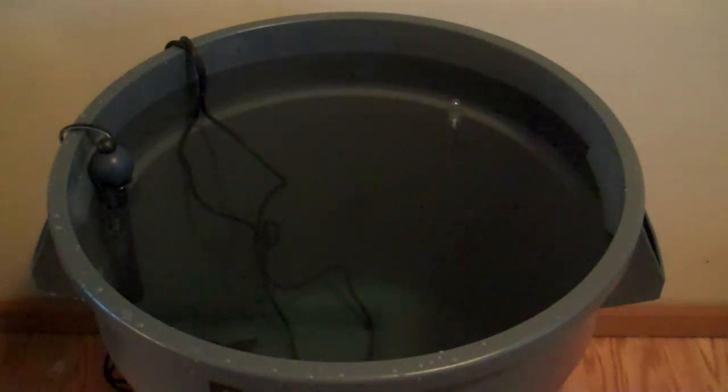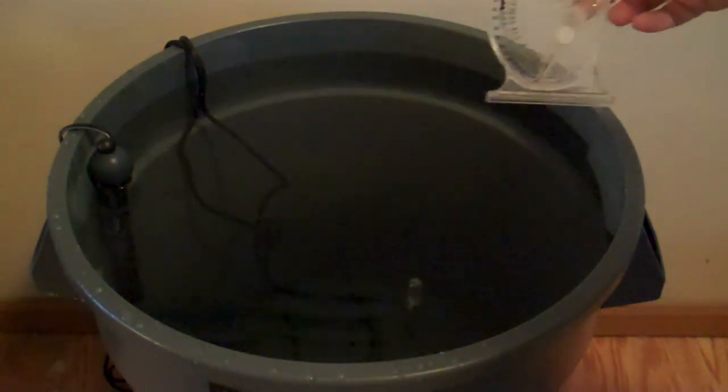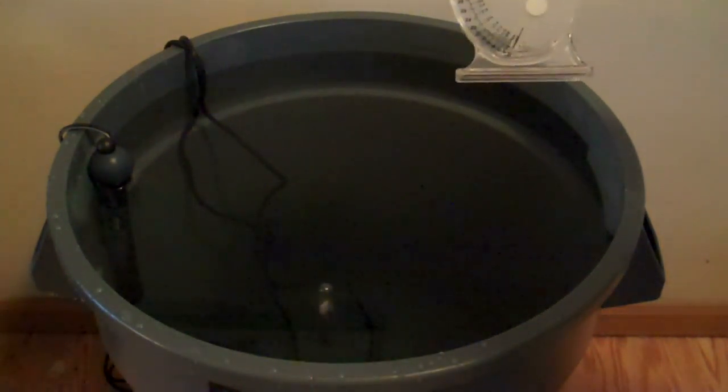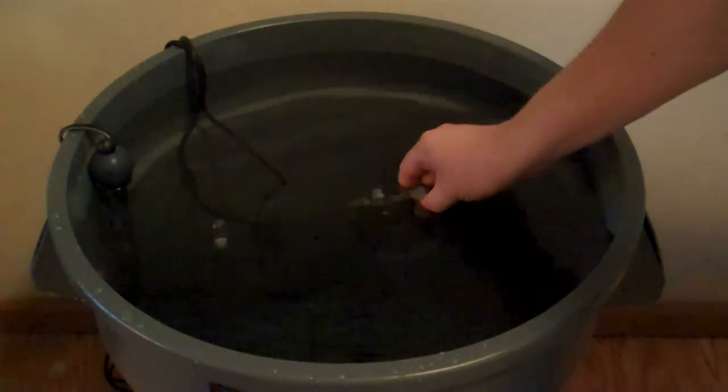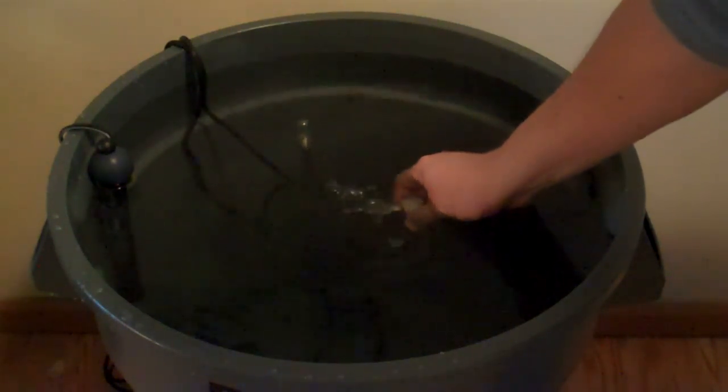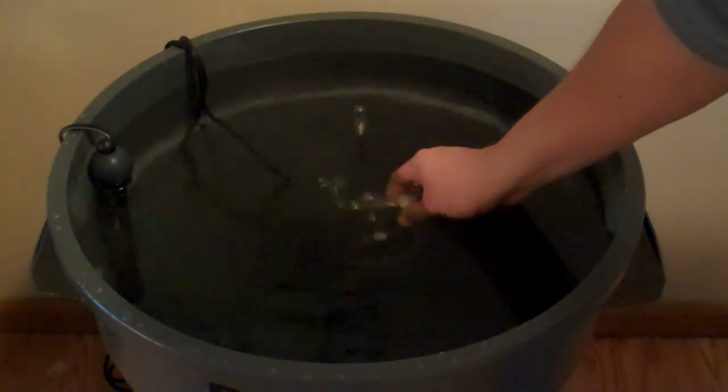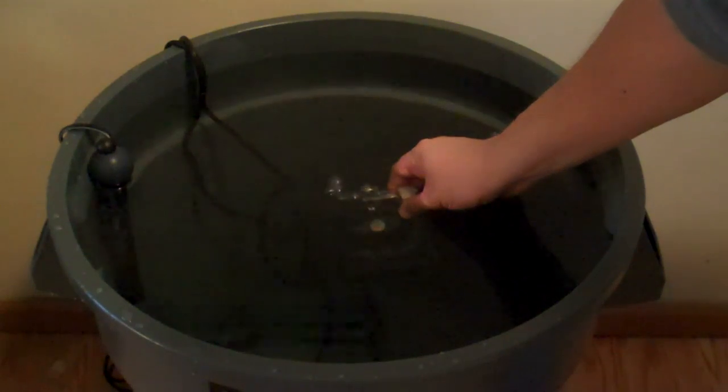To test the salinity with a hydrometer, you put the hydrometer six inches under the water until it fills up to the fill line. There's a fill line in there that tells it to level.